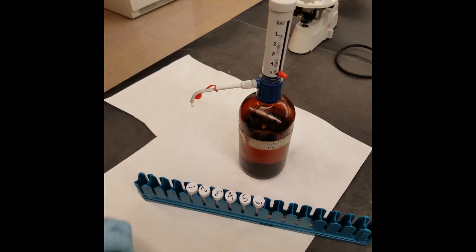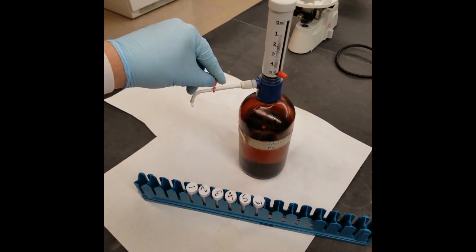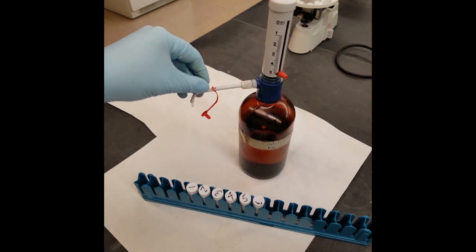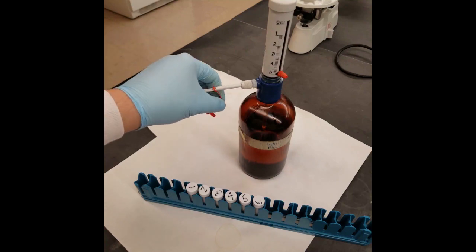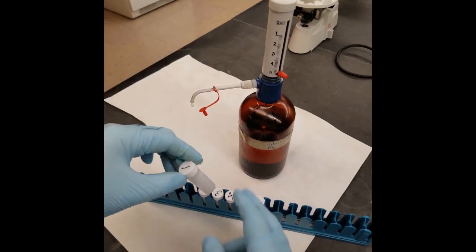Remove the protective cap from the end of the nozzle, place your vial underneath the nozzle, gently lift the gray pump, and slowly push it down to dispense the scintillation fluid.